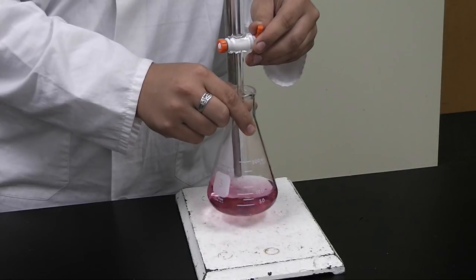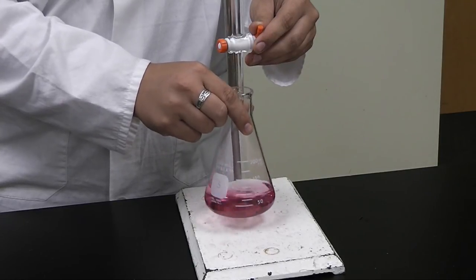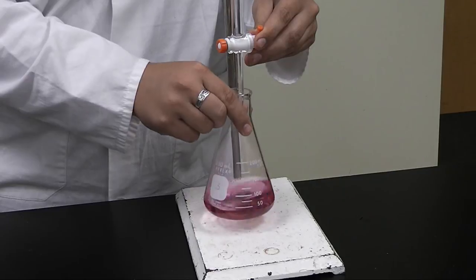You do not want solution pouring out of the burette, simply a constant drip, as you do not want to overshoot your end point.